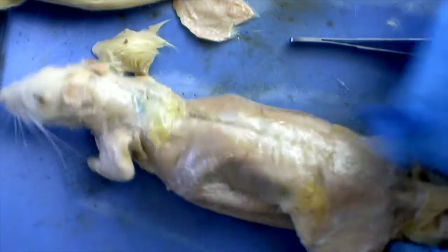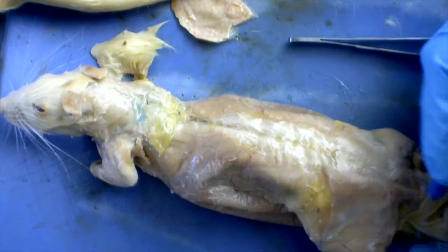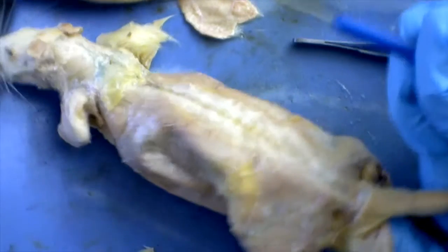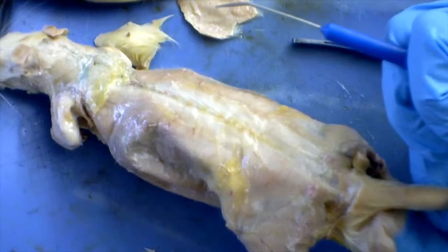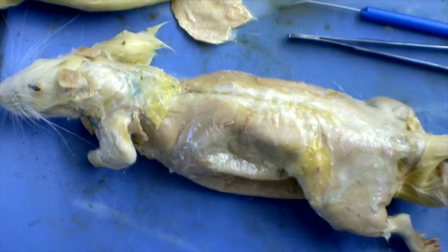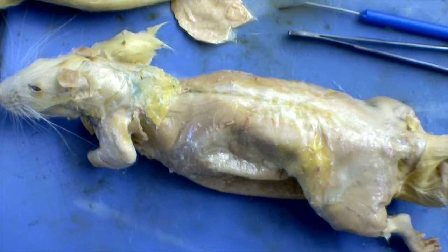And you can see down here on the end of the foot, we have the Achilles tendon, which is important to note, since rats and humans both have this muscle. That's located on the hind legs, just above the ankle. So basically those are all the muscles of the rat, just a quick overview of those.